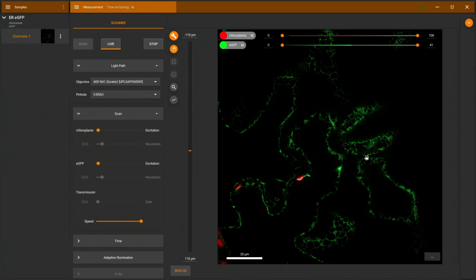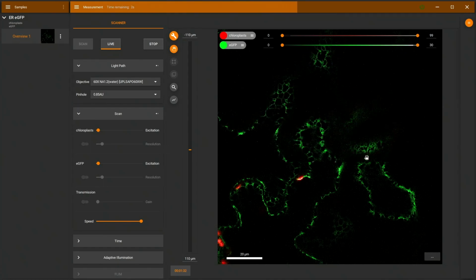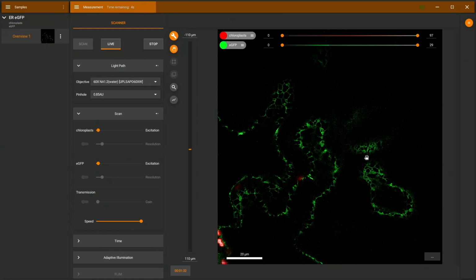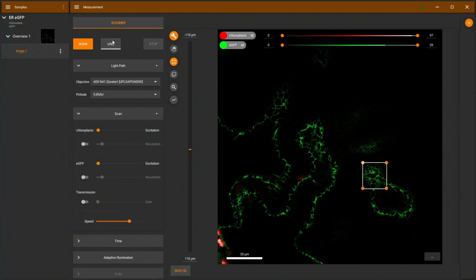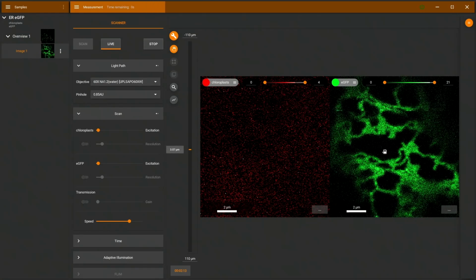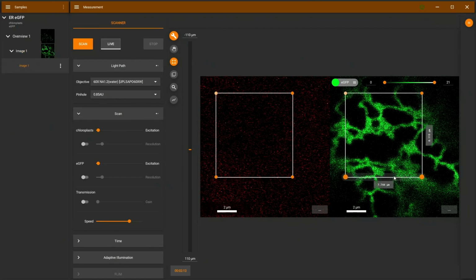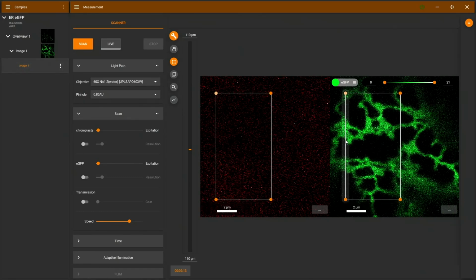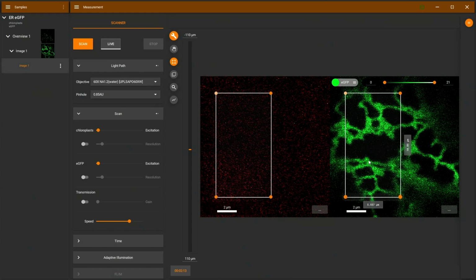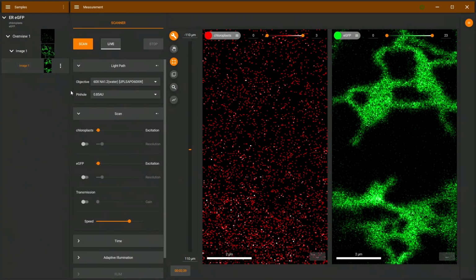We're going to look for a nice area with nice ER structures. And I think there's an interesting area. Let's stop the scan here and select this area here. In live mode, we can zoom in here and we see a few string-like structures and a few more sheet-like structures. Zooming in a little bit further, I can adjust my region of interest to exactly the size I would like. So here about 5 × 10 micron maybe. And there. If I scan there, yeah, we're now in the right area.